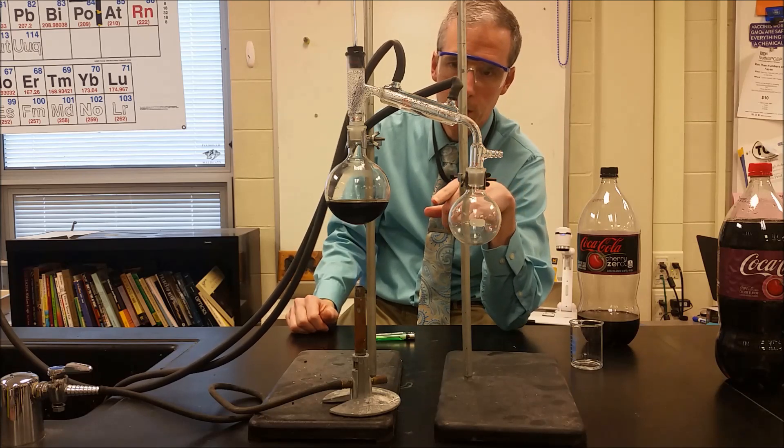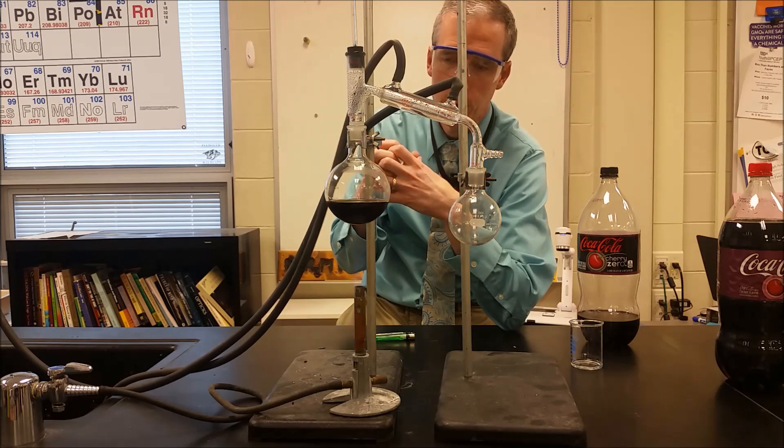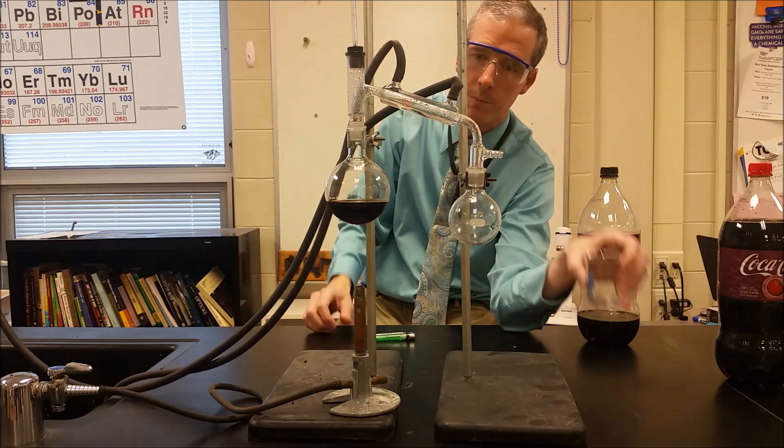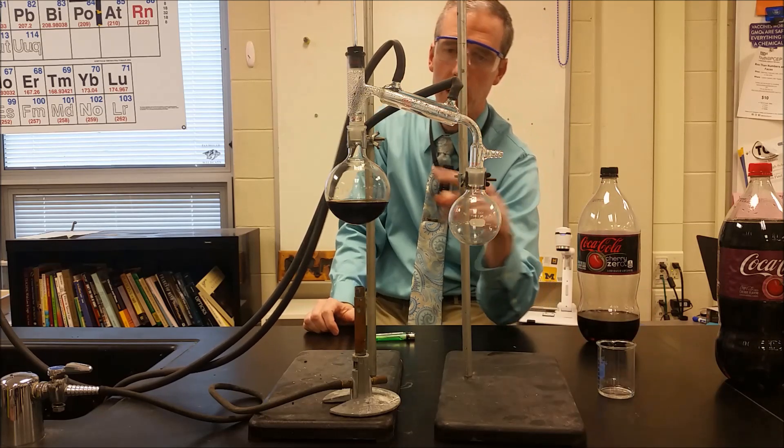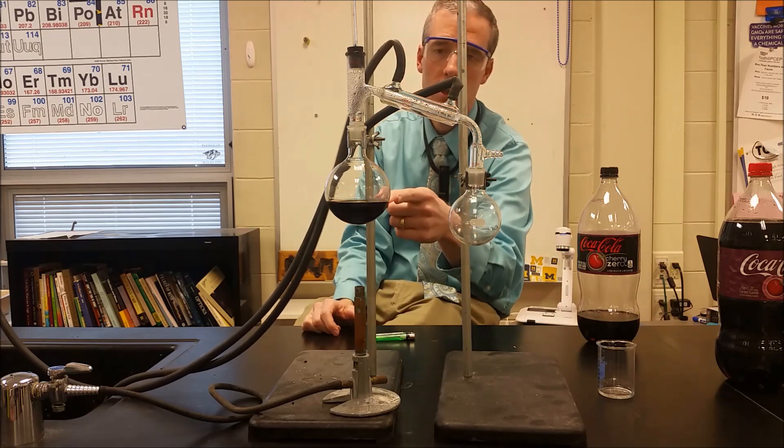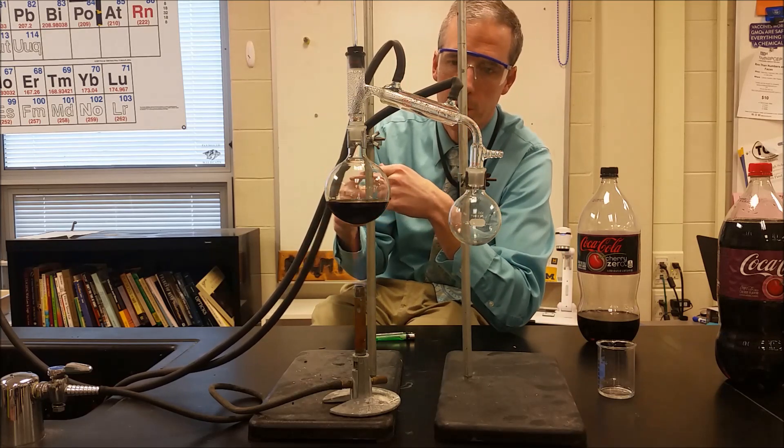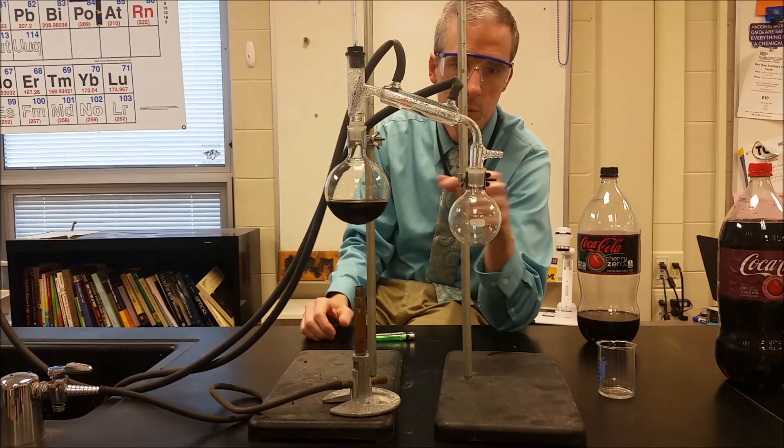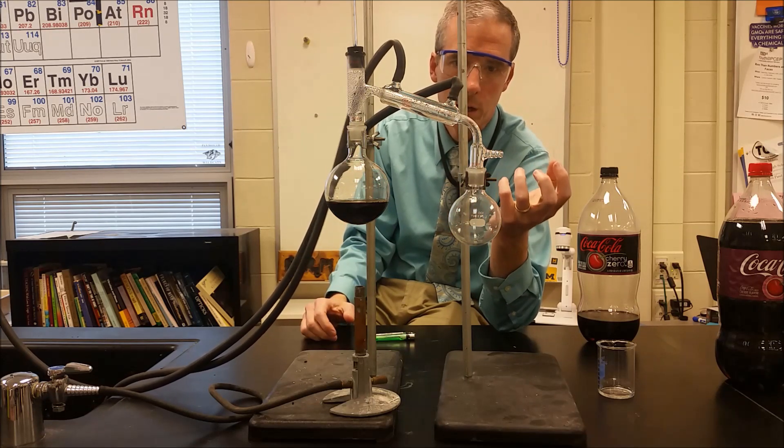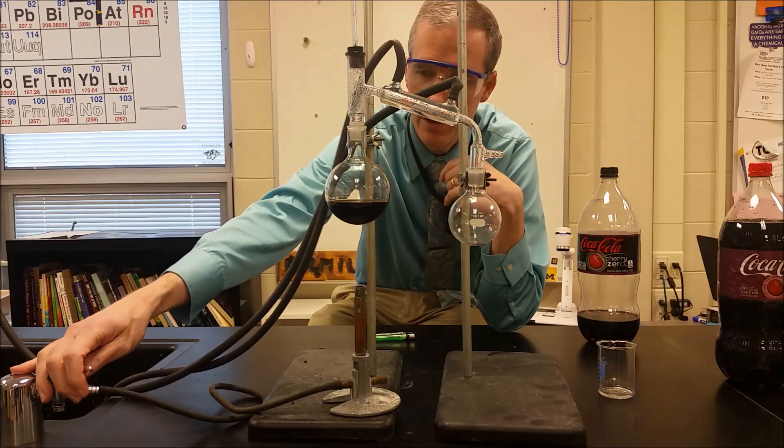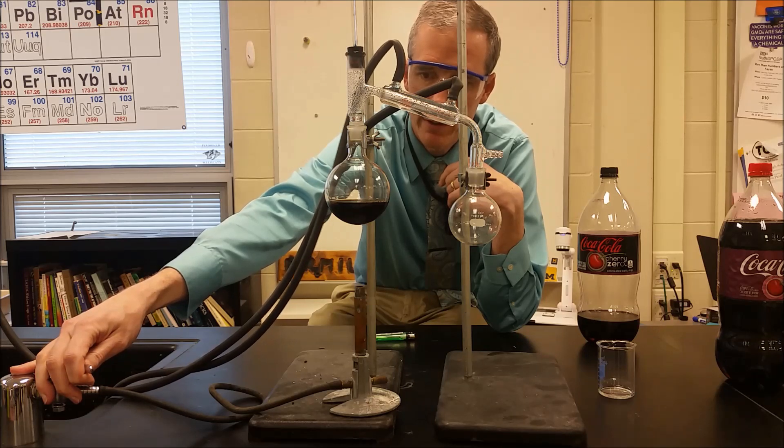But what we are hoping to see is some kind of clear and colorless mixture like we saw with the Cherry Zero that comes and collects in here while the cola components otherwise stay in here. So we're hoping the sugar stays in here, the coloring, maybe the phosphoric acid, and some of the water. But instead we see whatever ester or whatever compound is giving us that scent and smell and taste of cherry can come into the other component.